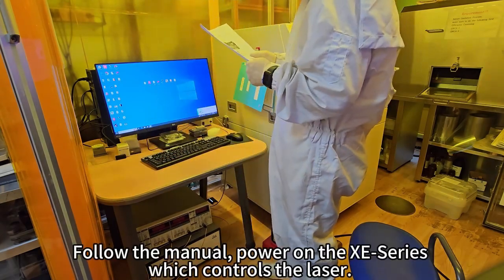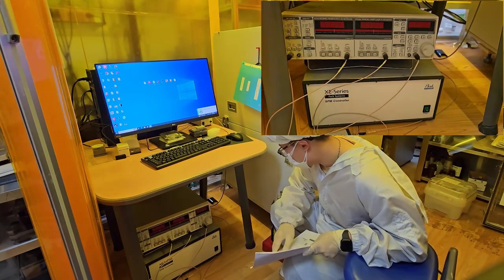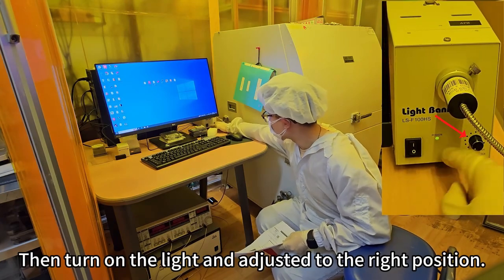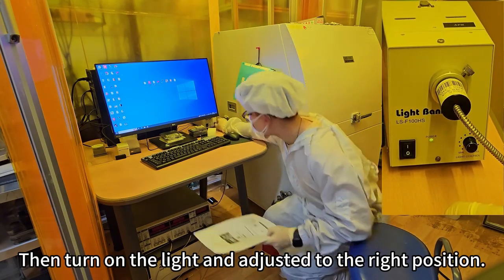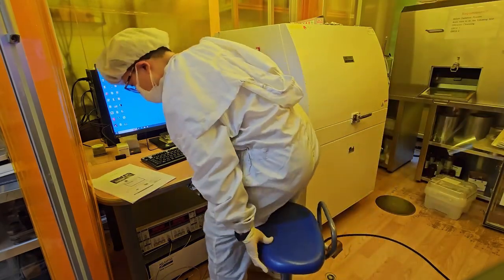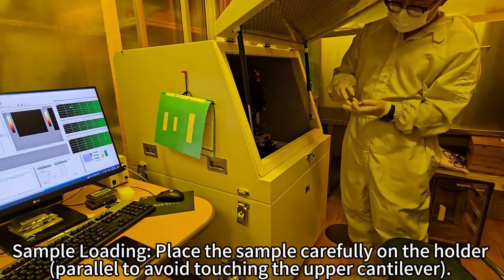Follow the manual, power on the XE series, which controls the laser. Then turn on the light and adjust it to the right position. Sample loading: place the sample carefully on the holder, parallel, to avoid touching the upper cantilever.